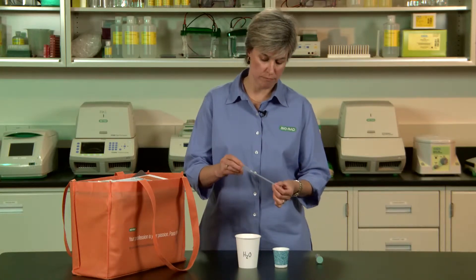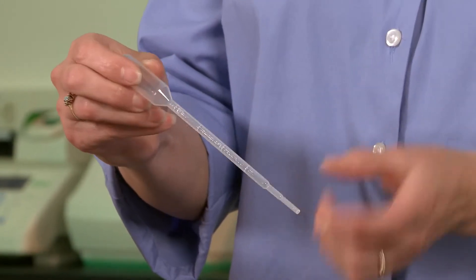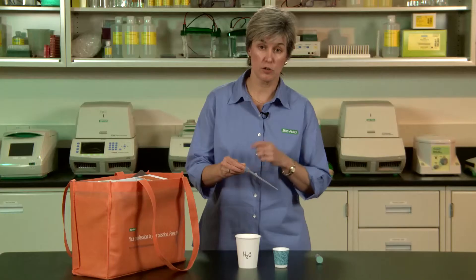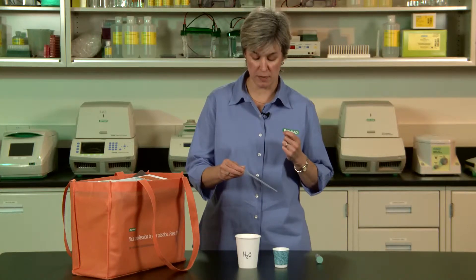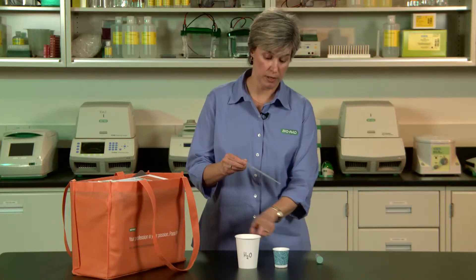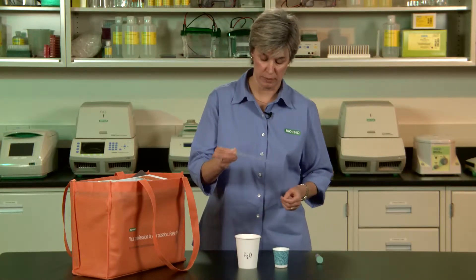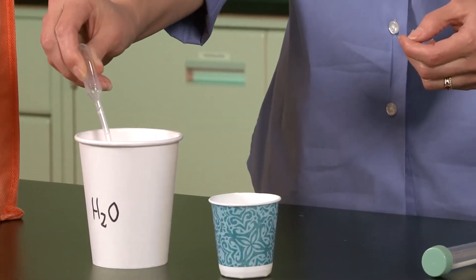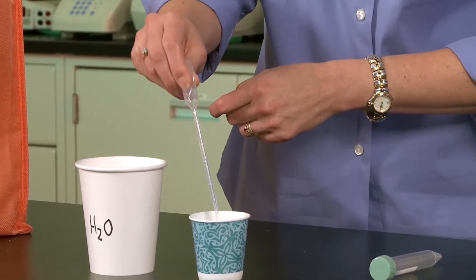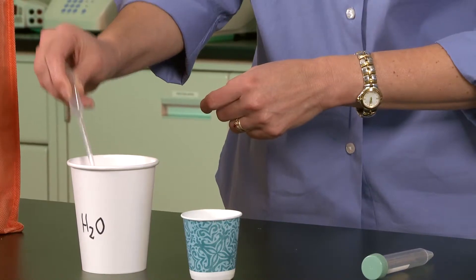The transfer pipette is a really simple device, a lot like an eyedropper. It's got a bulb at the top that you squeeze and some markings on the side. Right here, just below the bulb, is one ml. The students need three mls of water for this activity, so have them transfer three mls of water from the big drinking water cup into their own personal paper cup. Squeeze the bulb, put the tip right into the water, and draw up. At the one ml mark, transfer it into the little cup. Have the students do this three times — they're going to start feeling like little scientists right away.